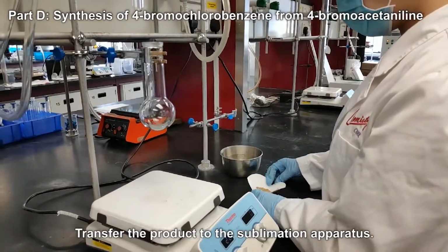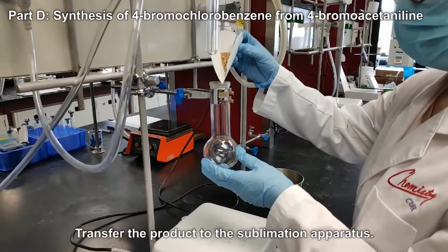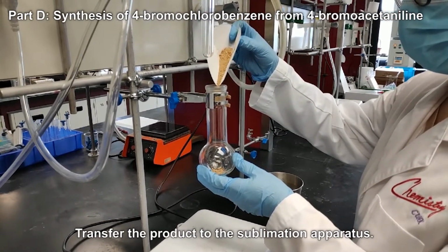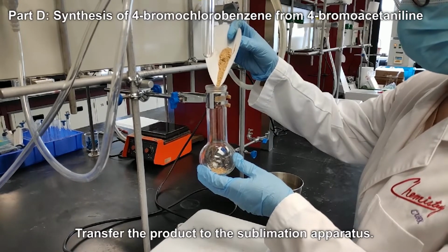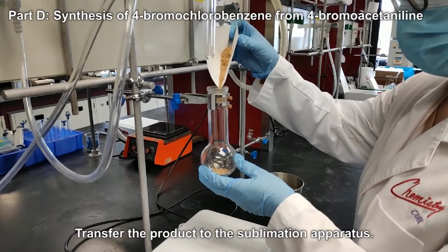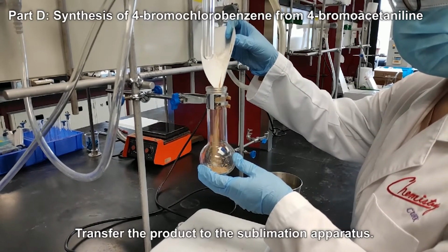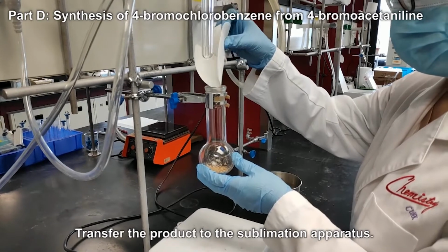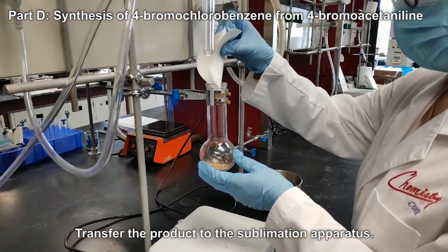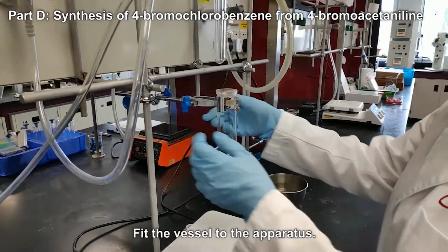Transfer the product to the sublimation apparatus. Fit the vessel into the apparatus.